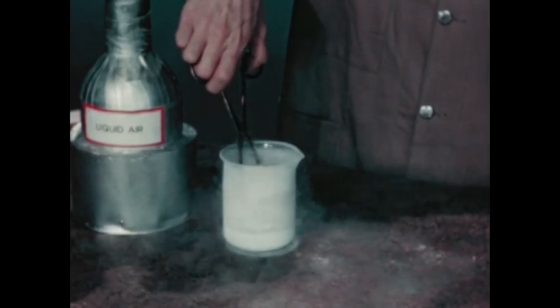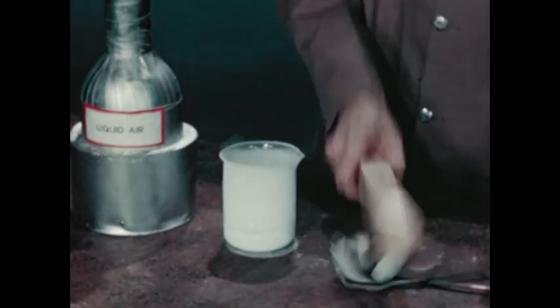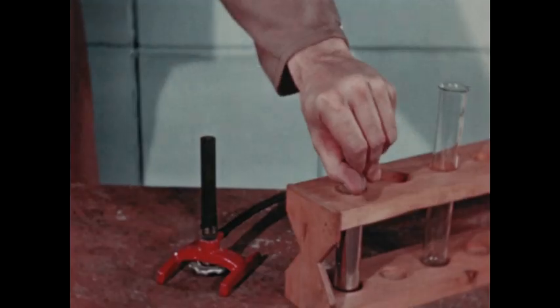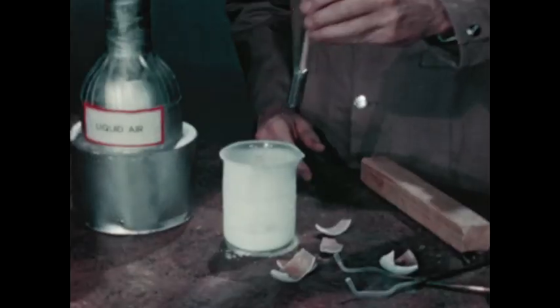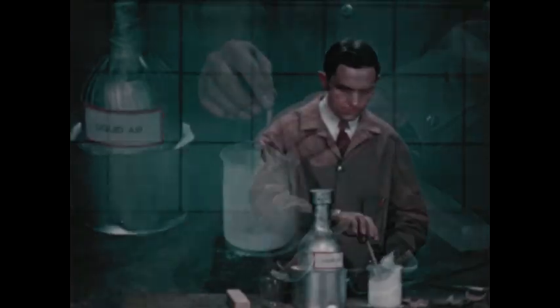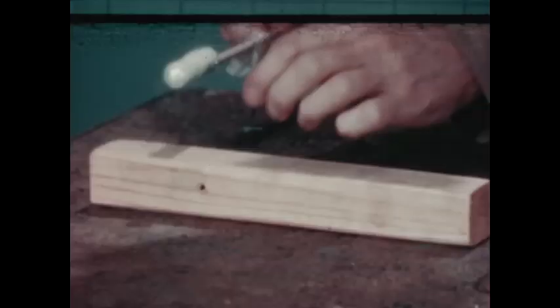The extreme cold of the liquid air destroys the elasticity of the rubber ball. This is mercury, a metallic liquid element at ordinary temperatures. Mercury freezes very quickly at this low temperature and it is frozen solid enough to use as a hammer for this small nail.